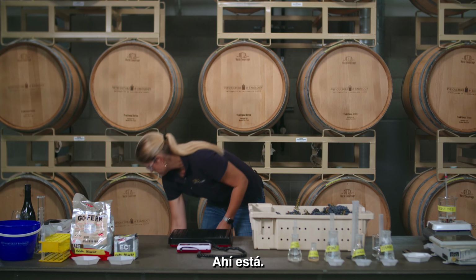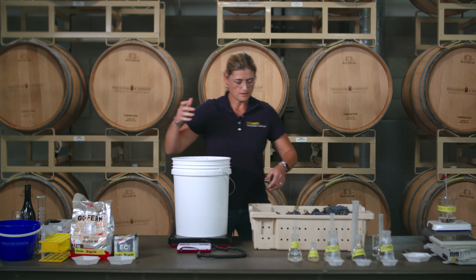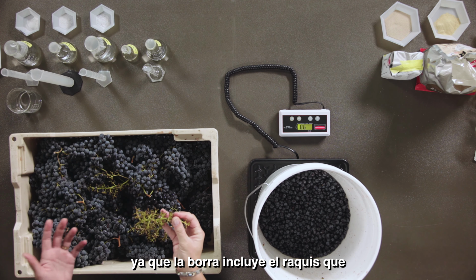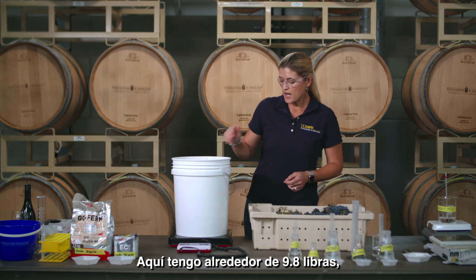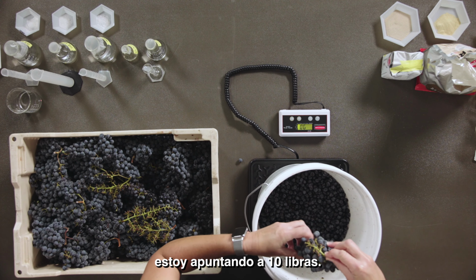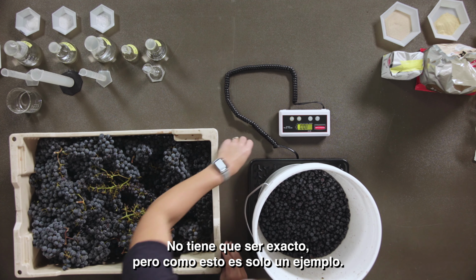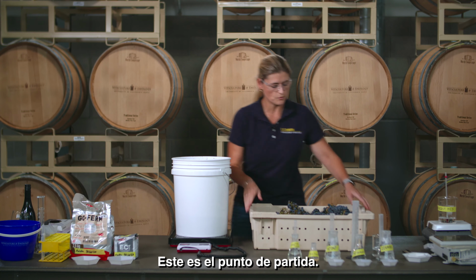There it is. Then I can destem my clusters, as the stems, which include the rachis, can potentially be a source of smoke impact compounds. I have about 9.8 pounds there. I'm aiming for 10 pounds. There we go. You don't have to be that exact, but this is just for an example. So this is my starting point.